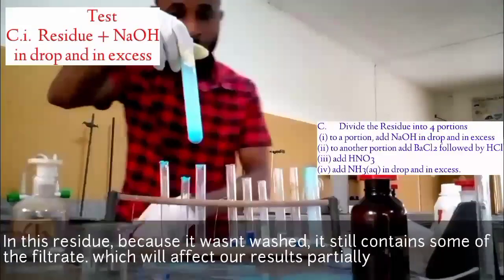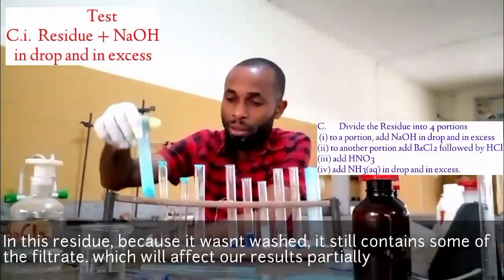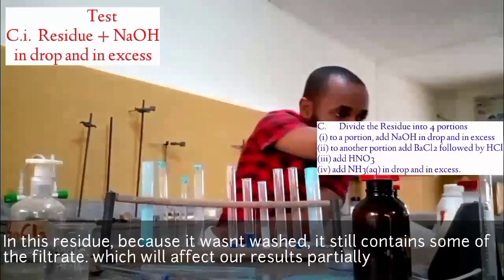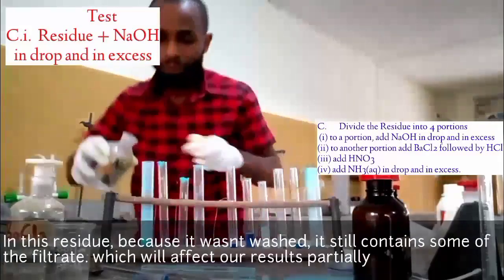Okay, that's the color we are having. Now let's add sodium hydroxide to this. I hope you can see the color. The sodium hydroxide. This is my sodium hydroxide. Now let's add.